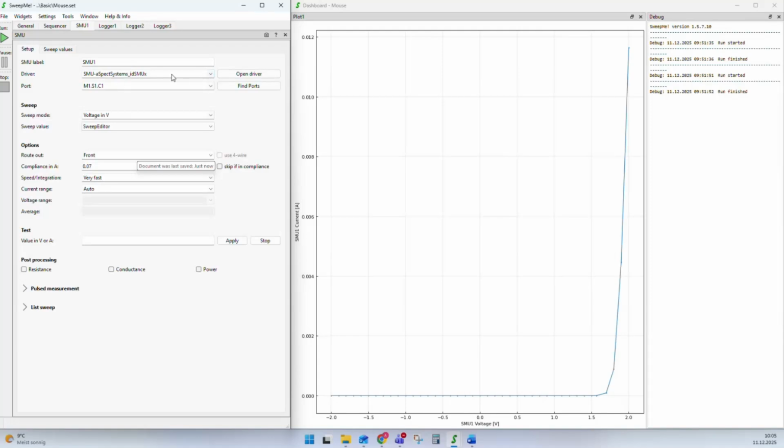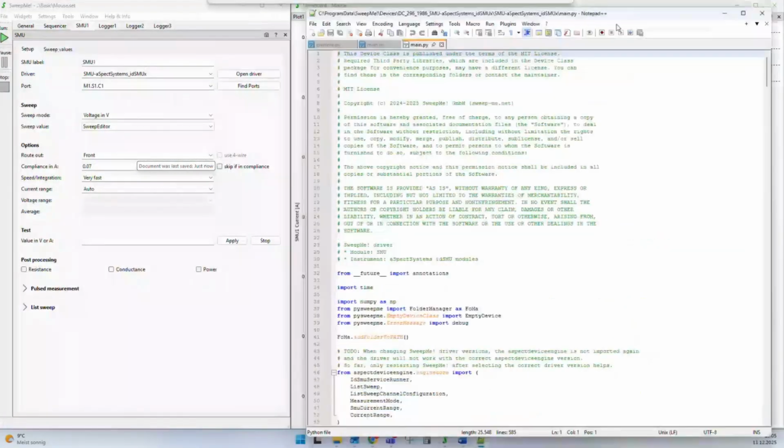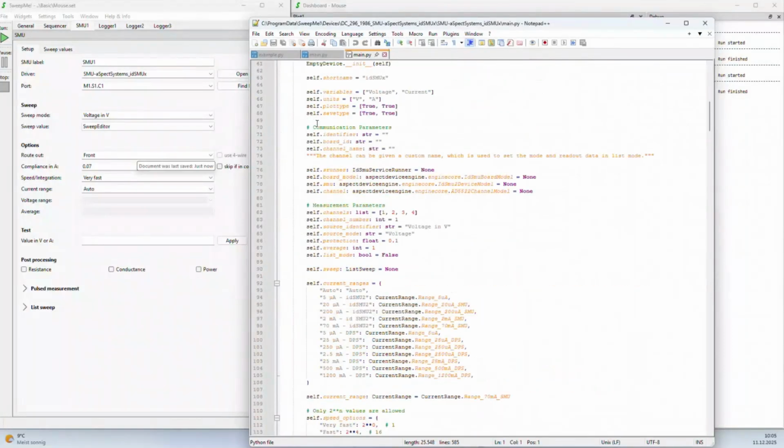In the SMU module, there is always a field called driver, and there you can select the driver. These drivers are basically Python files. We can also open them to have a look into the code. It is basically a Python file with a class and different functions in it.